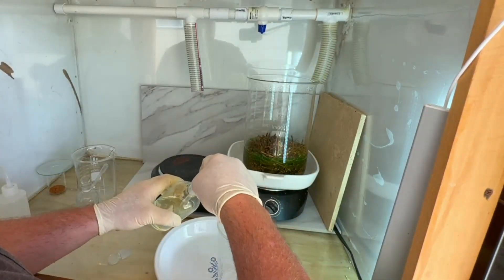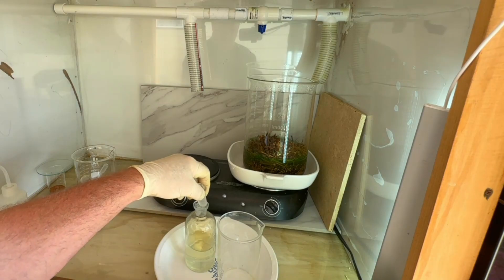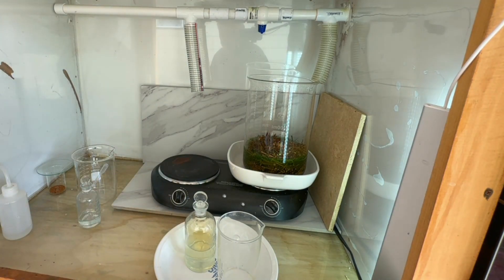I suspect there's still some copper in here. I expect anywhere from eight to nine grams of gold, so there should be plenty of reagent. We may have a little bit extra and we'll cover that up.